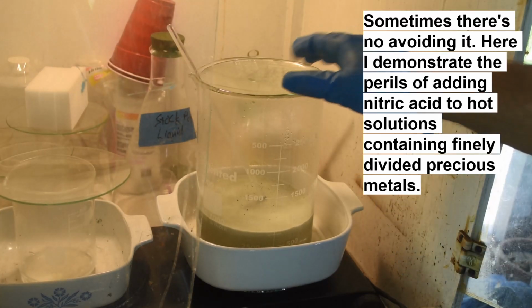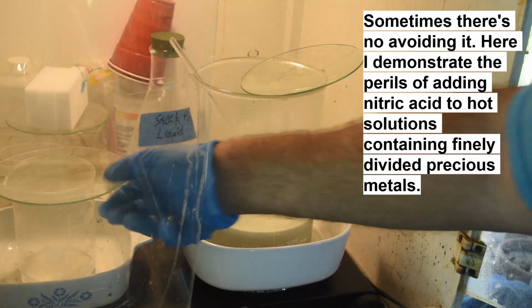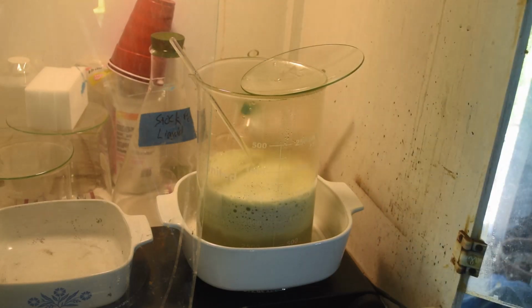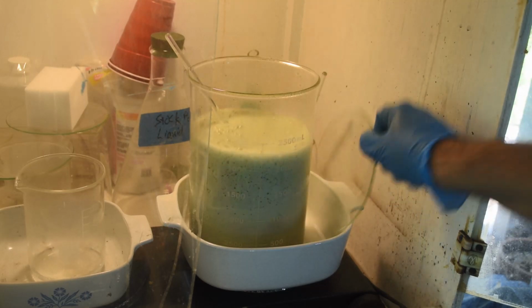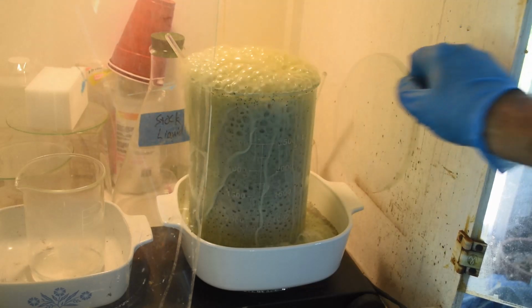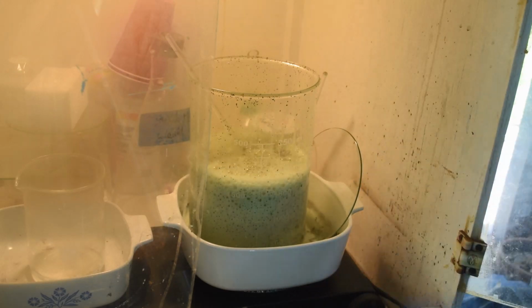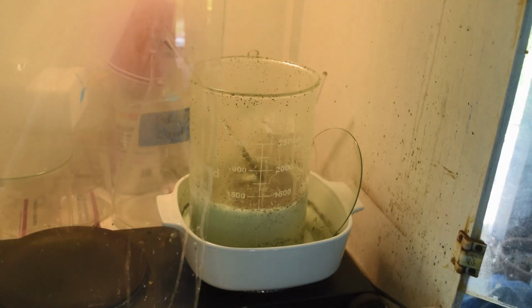Okay, the liquid's heated up to the point where it's boiling some, so I think it's time to put in the rest of the acid. Slowly, because it's really hot now. Oh yeah, look at that. Look at that reaction. Whoops. Uh-oh. There we go. There she blows. Oh no. Okay. Well, now you see why I have a Corningware dish there. So I've just turned the heat off completely, and we've caught everything there. In fact, let me move this off the heat because it's sitting there boiling in the Corningware dish.